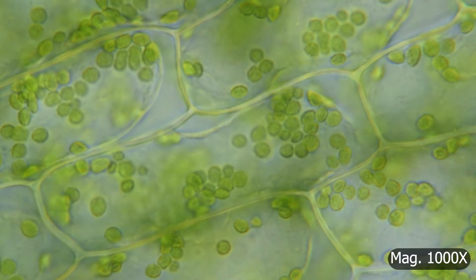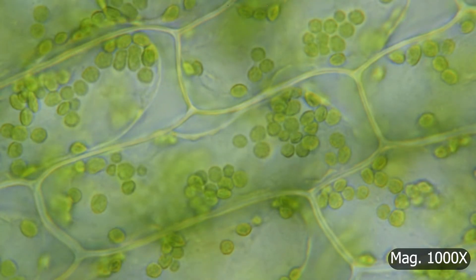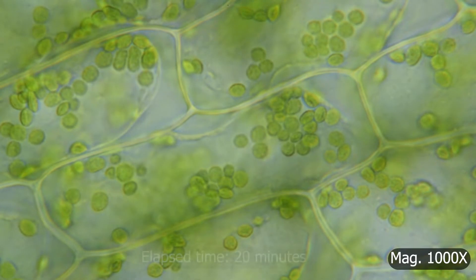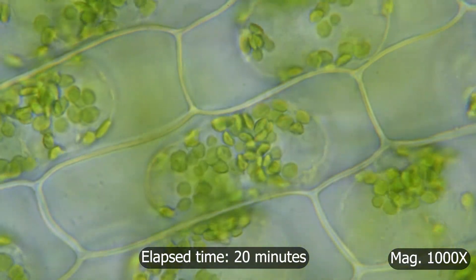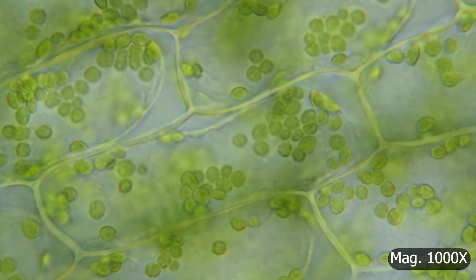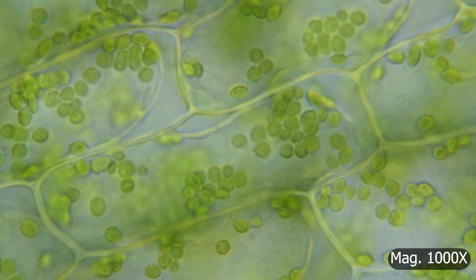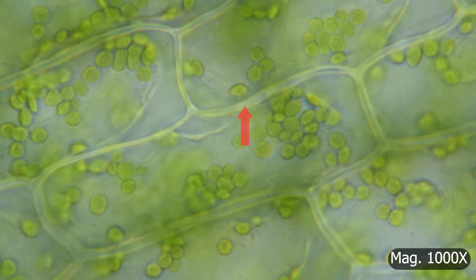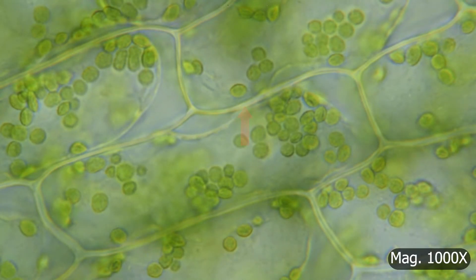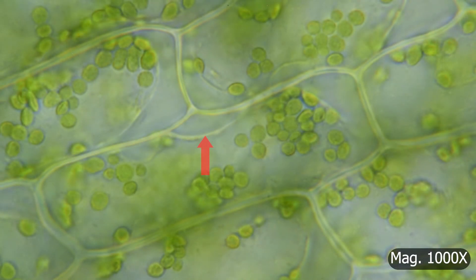These are plant cells. Plant cells contain both a cell wall and a cell membrane. The cell wall is rigid and creates a supportive frame for the cell. The cell membrane, however, is soft and can easily change shape.